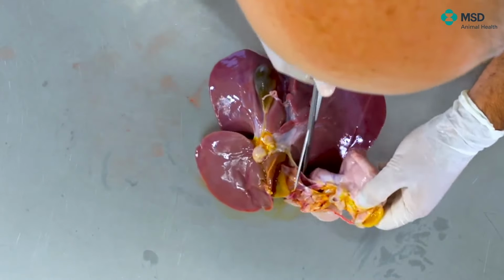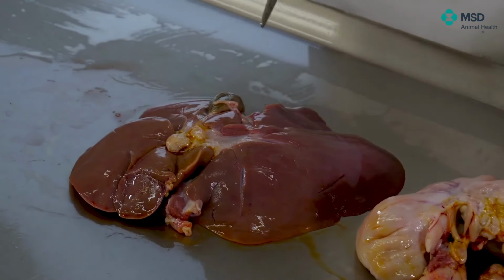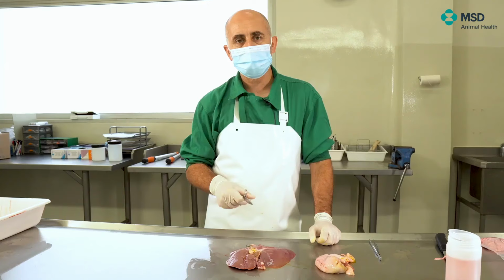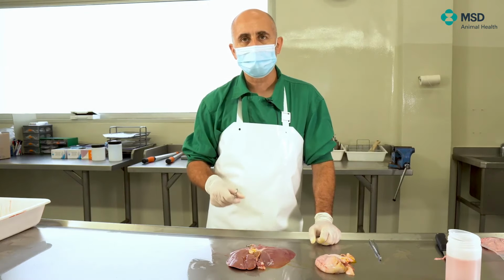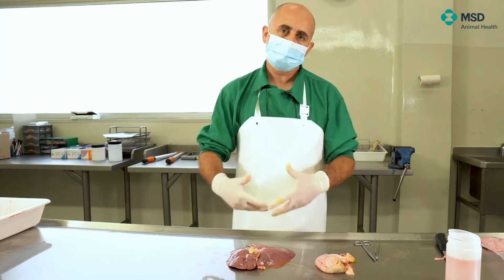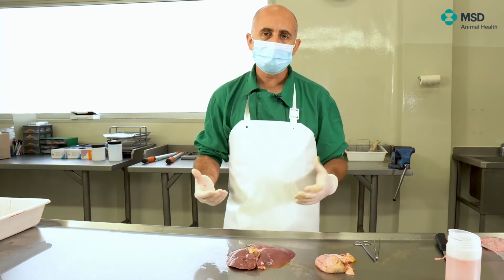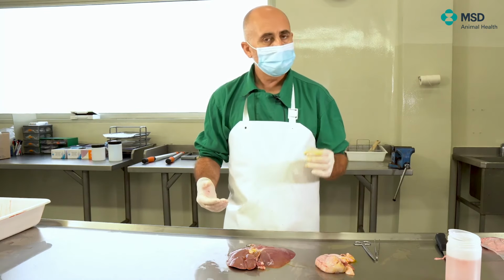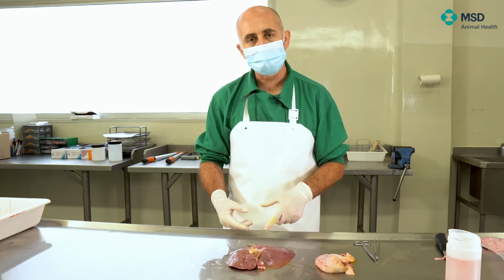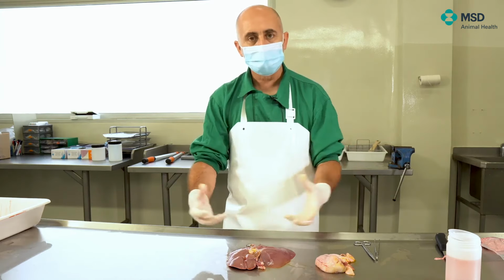Very important, what you see here is the gastrohepatic lymph node. The gastrohepatic lymph node is extremely important for some diseases, especially African swine fever. In African swine fever, of course, there's a kind of hemorrhagic diathesis, and there are certain lymph nodes which are especially affected. The most affected one, in general terms, is the gastrohepatic one, which looks very red, like a blood bag sometimes, and much increased in size, okay?